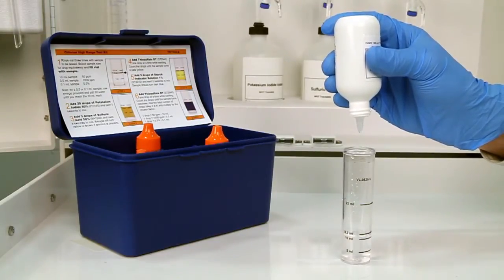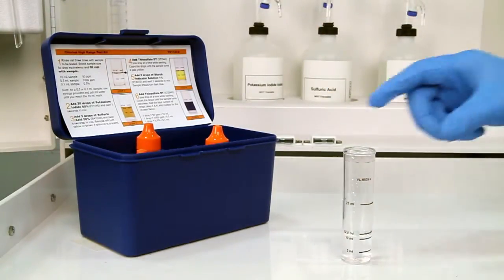After the addition of each reagent, swirl the vial five seconds to make sure the reagents are properly mixed.